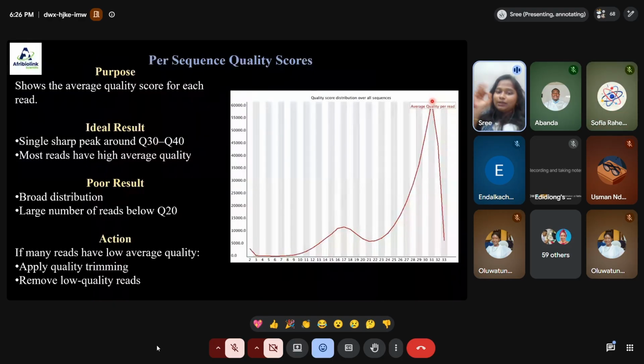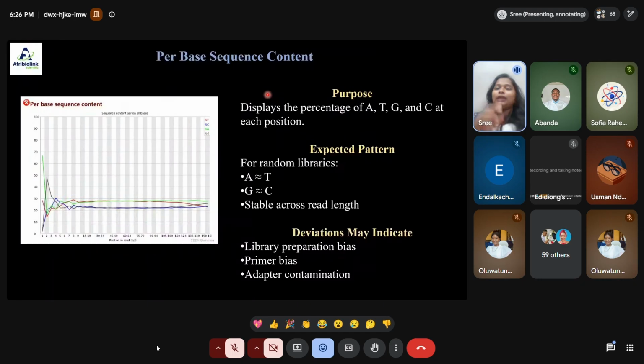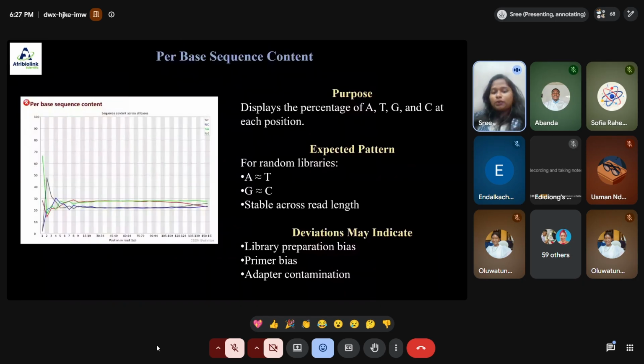The next thing is per base sequence content, which helps to understand the percentage of content, how the nucleotide positions are. Whatever the pattern is, you can see the pattern should be in a straight line. If it deviates, it may be due to an error in library preparation, or primer-based errors, or contamination that happened during the analysis. These are the reasons for what has taken place. We need to consider this, and we need to do a trimming process, because adapter contamination is there. These are the things which help to do a pre-processing step, that is trimming and filtering. We are going to see that next.